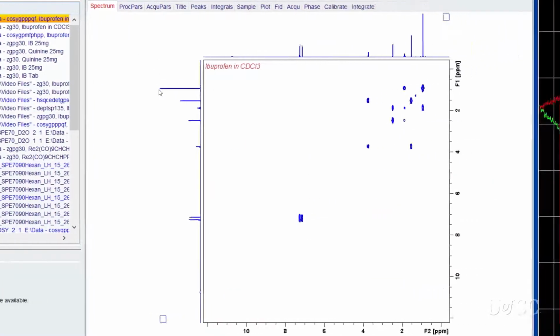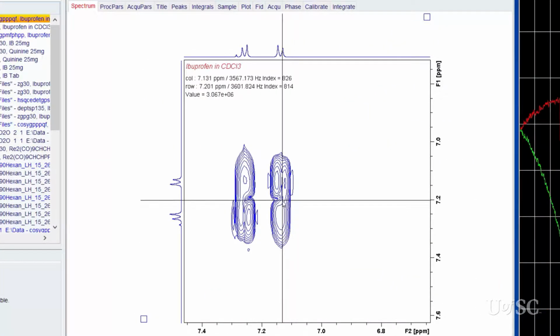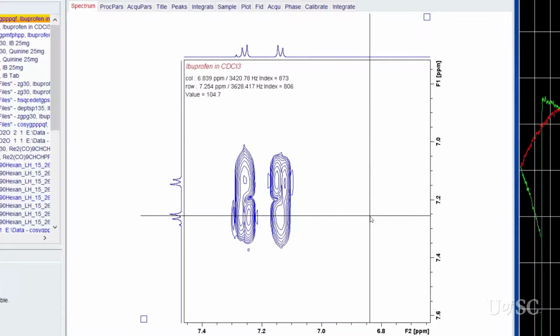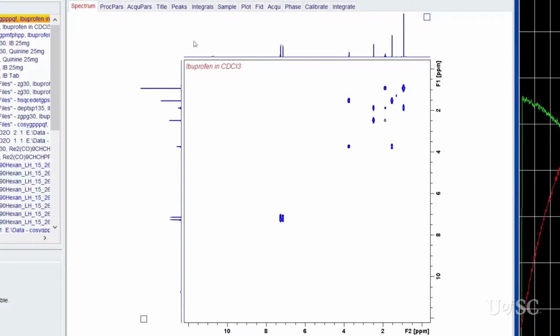The region with the aromatic proton shows some overlap between the cross peaks and the diagonal due to the low resolution in the F1 dimension. While the peaks run into each other, the cross peaks can still be distinguished from the diagonal to show that the two types of protons on the ring couple each other.